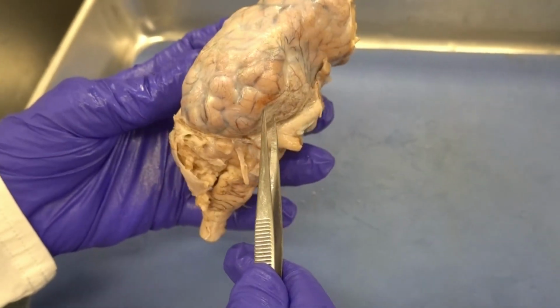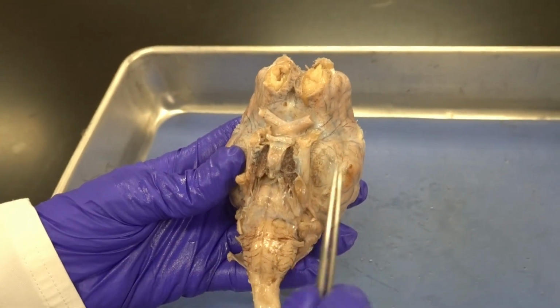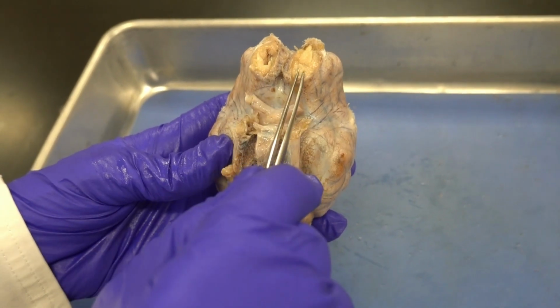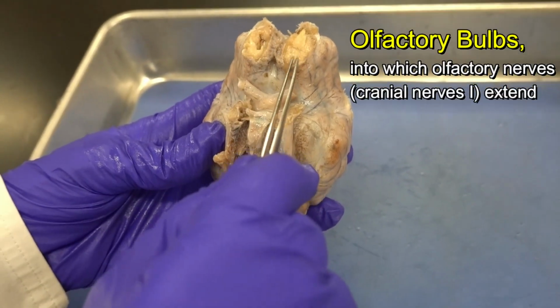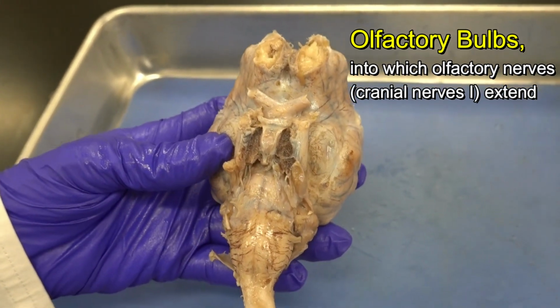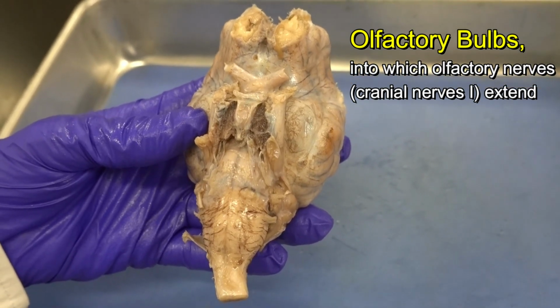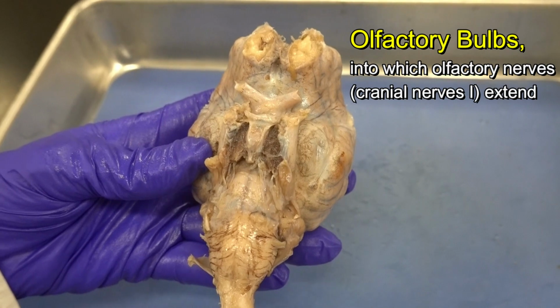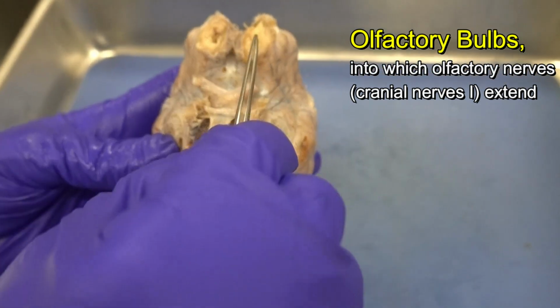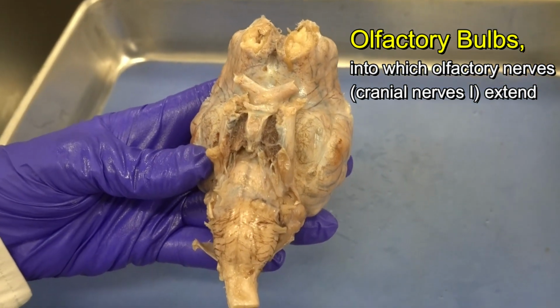I go to the other side. In sheep, obviously, that's the inferior part. What I see here, I can see the two cerebral hemispheres. The structures that you see here are the olfactory bulbs. The olfactory bulb is the place where the olfactory nerves, which are formed by the axons of olfactory receptor cells inside the nose, end. Olfactory nerves pass through the cribriform plate of the ethmoid bone, and eventually when they get here to the olfactory bulb, they form synapses, and then the olfactory tract is going to transmit the olfactory signals to the cerebral hemisphere.